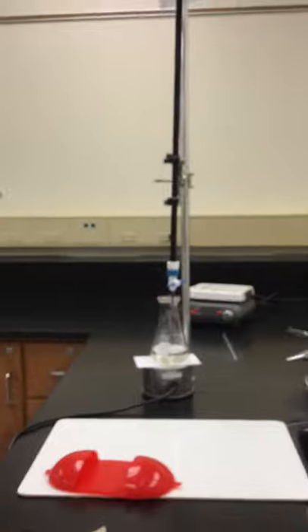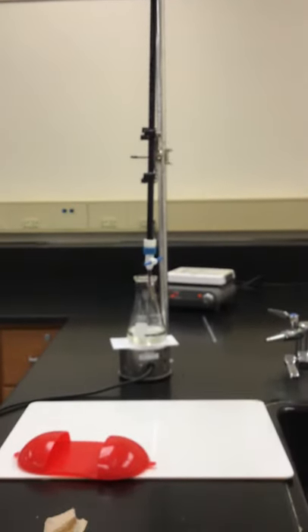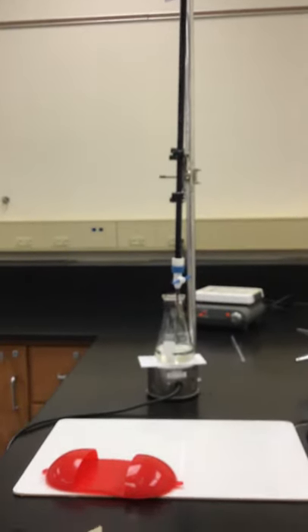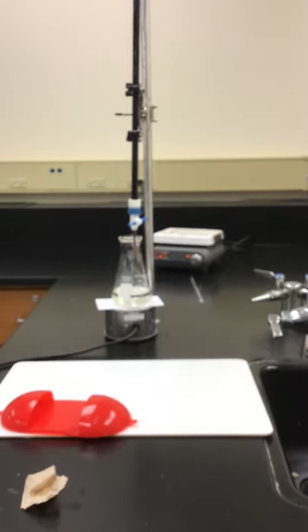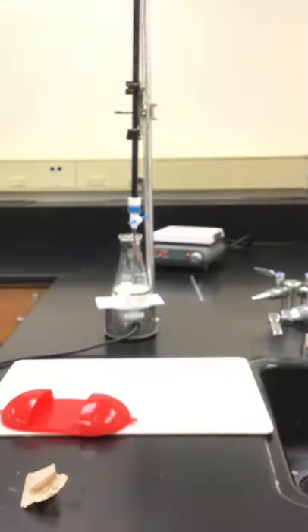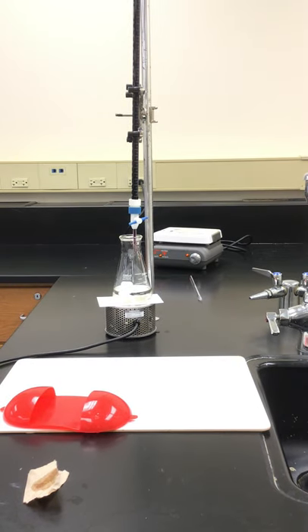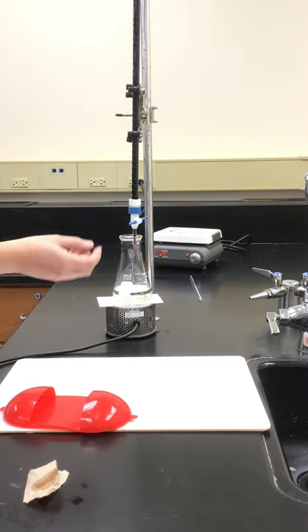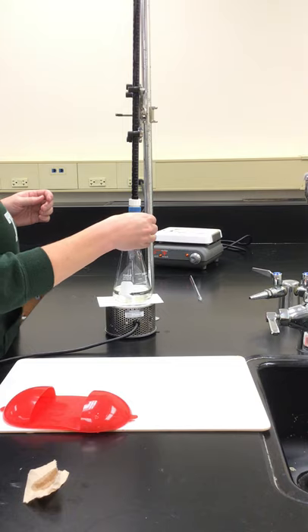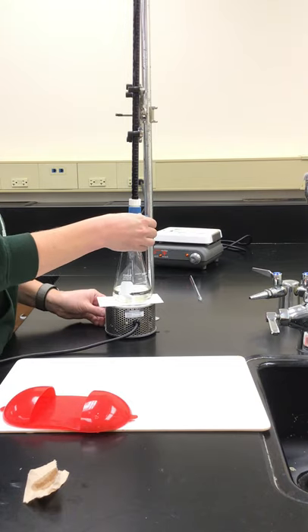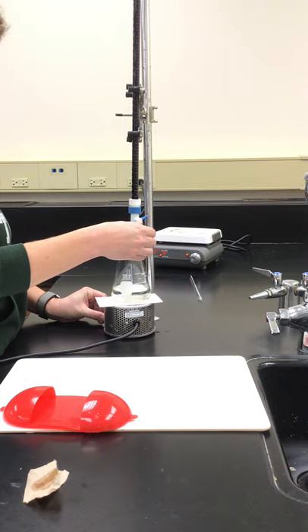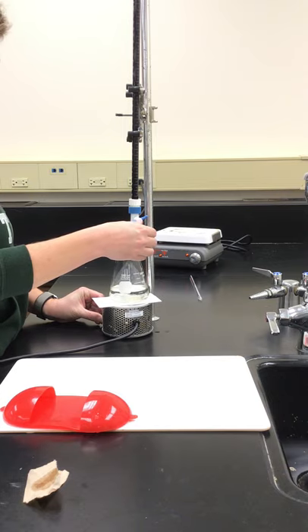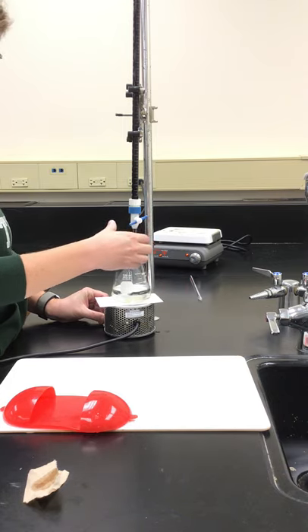We are going to titrate, and again we're looking for that light pink color. Here we go. Turn on my auto stir and we'll begin.